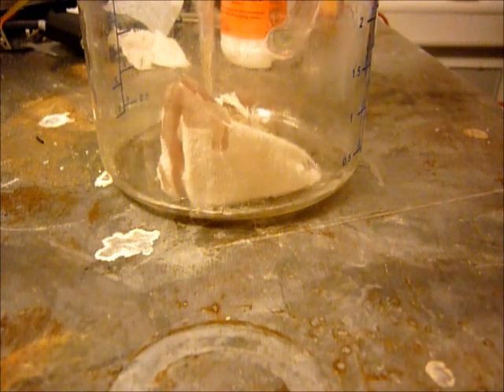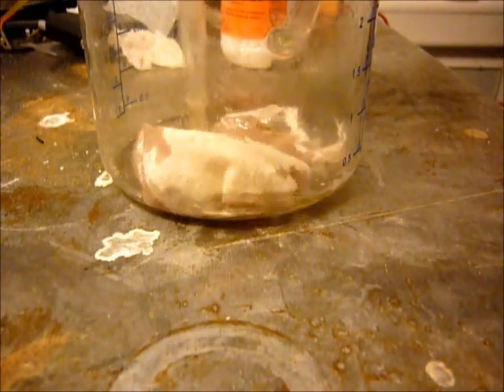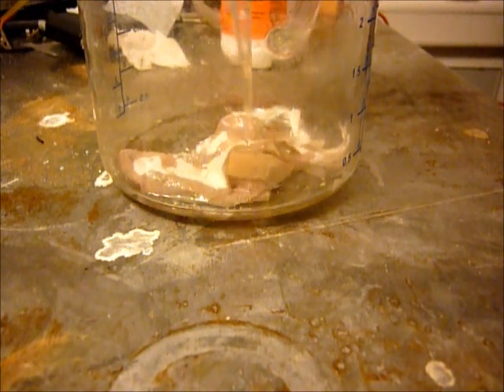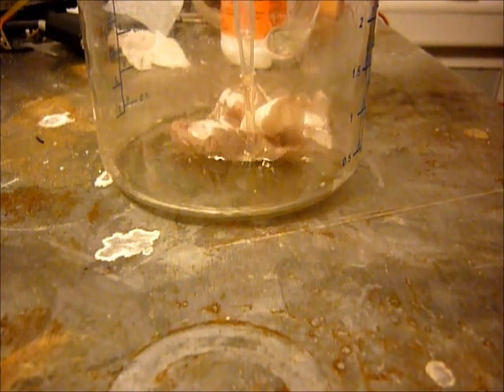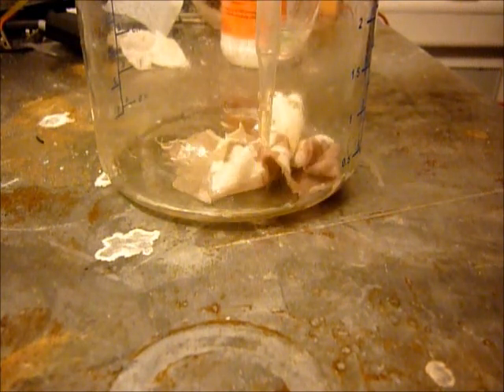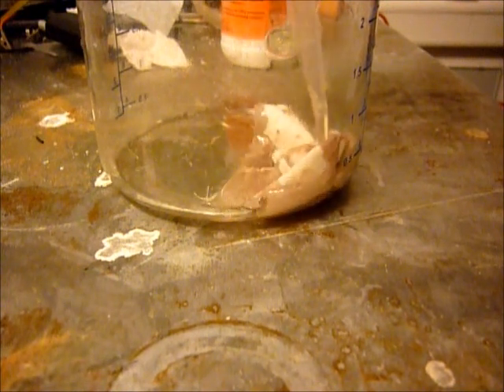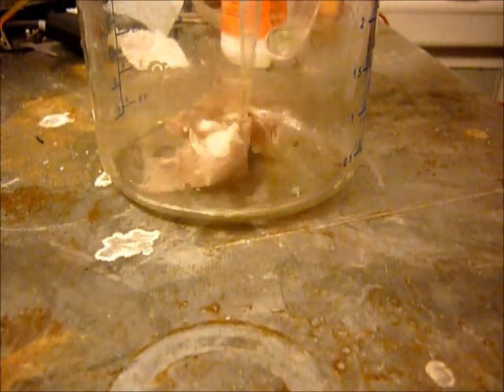I hope something will happen. I hope this was cotton. But if not... you see it becomes a little bit dark. And you see the cotton getting etched by the sulfuric acid.